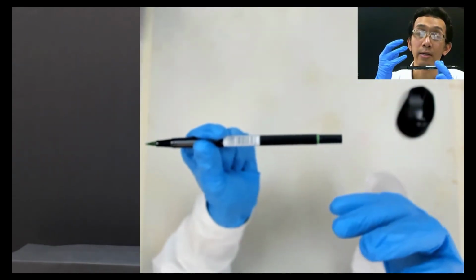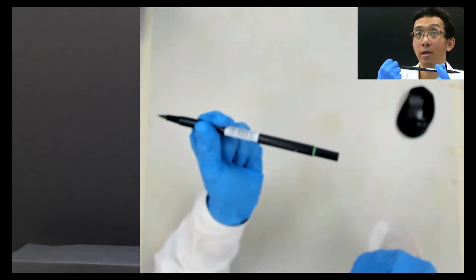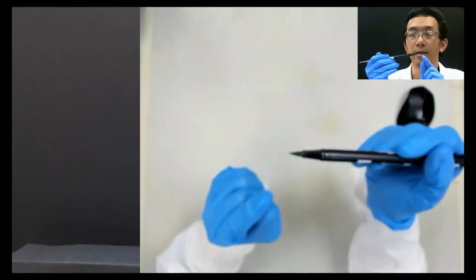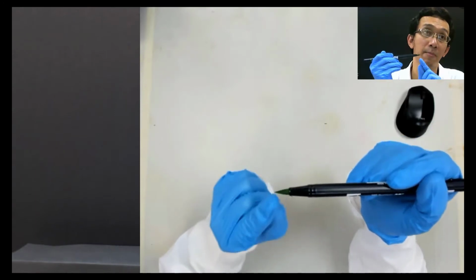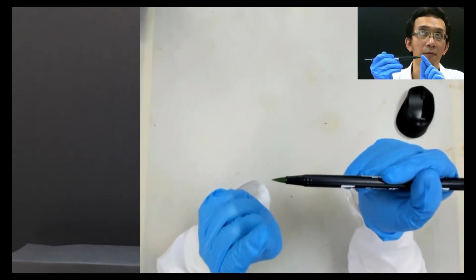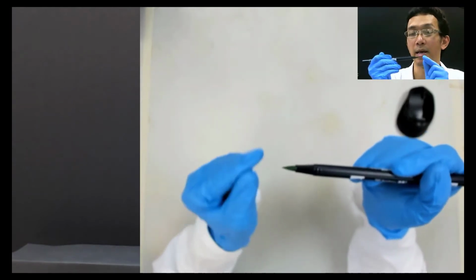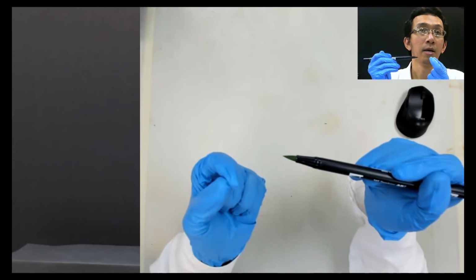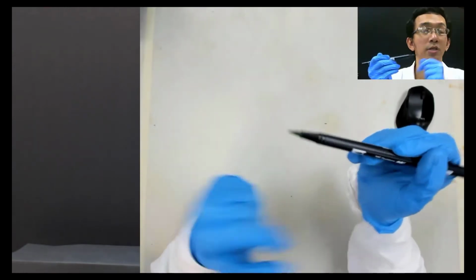When it dissolves, the water has the capability to push or kick this pigment. If this green pigment is made up of different pigments, for example color A and color B, making this green, then you can separate those colors using TLC.